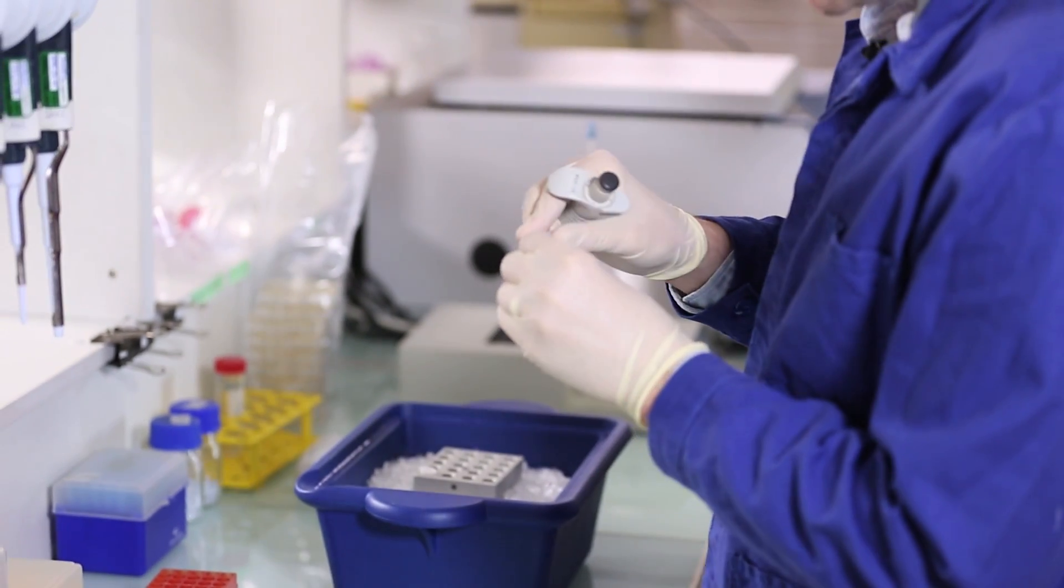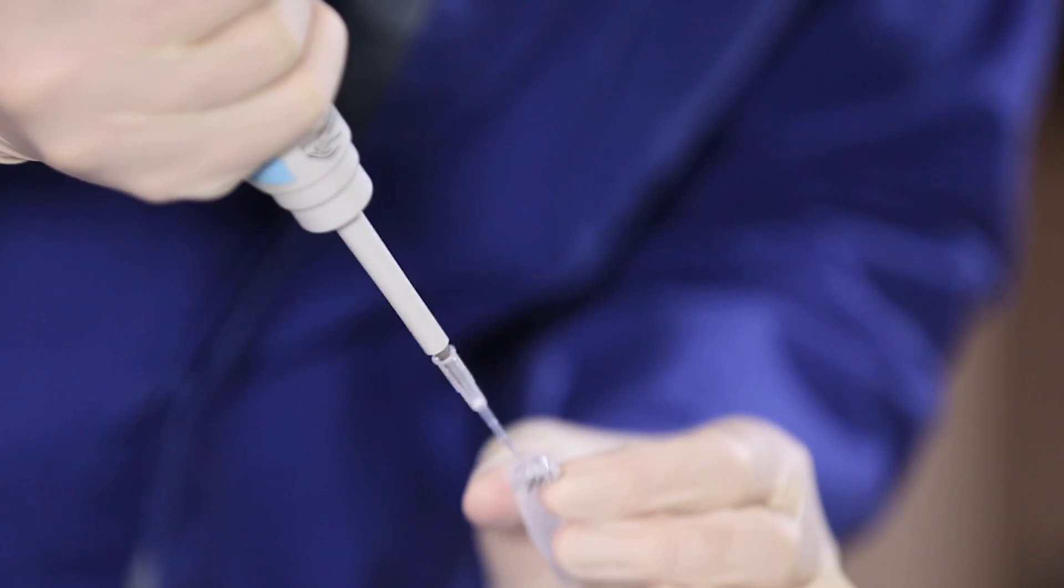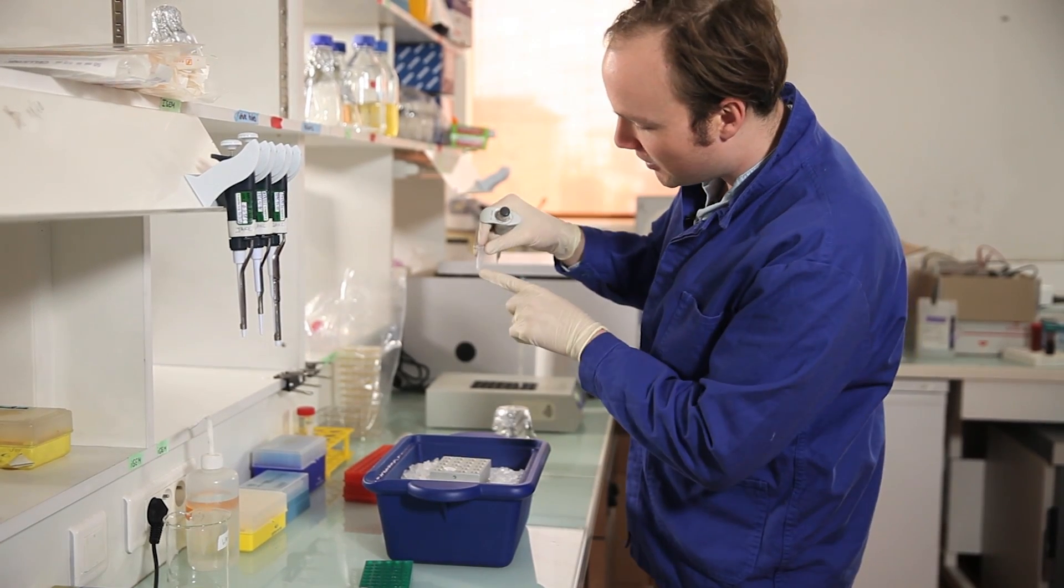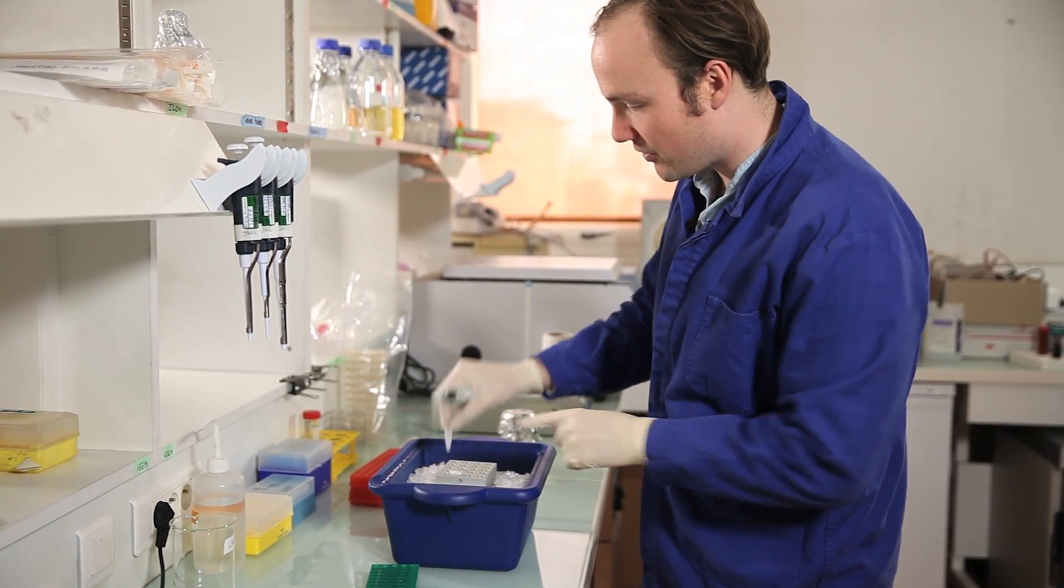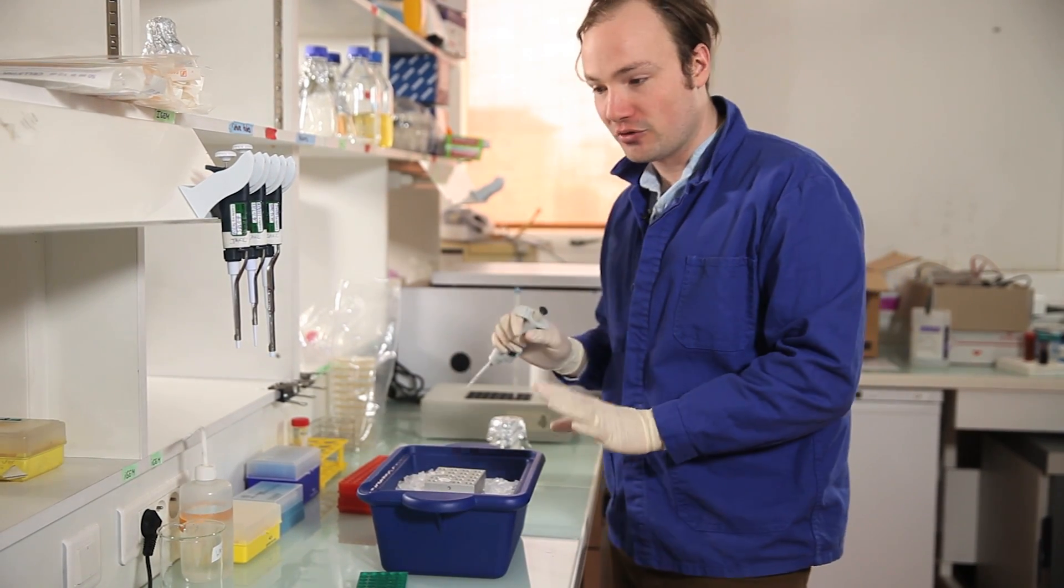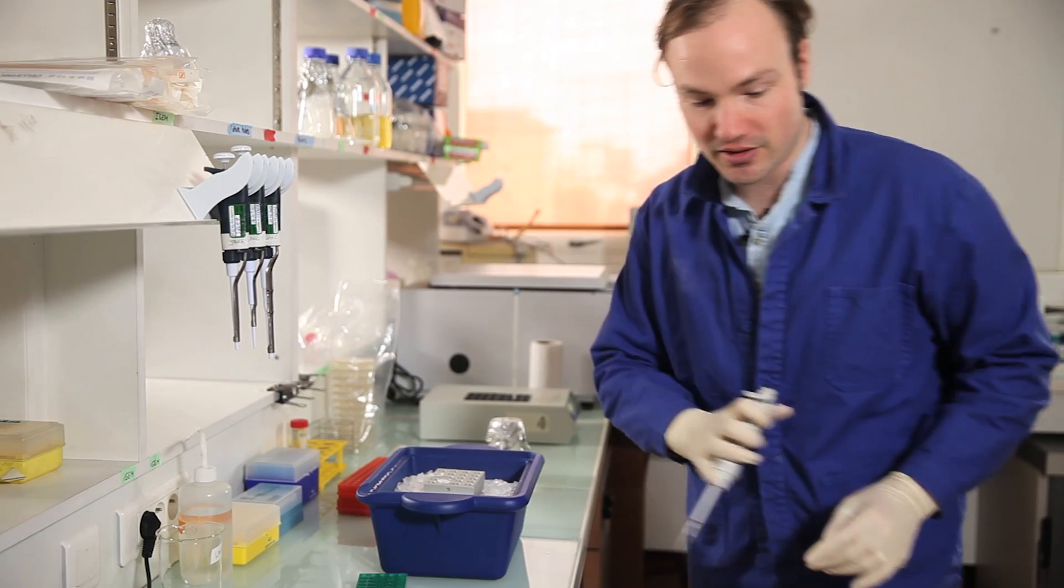Add that to our competent cells very gently. So you'll notice that I'm pipetting the plasmid directly into the cells, right? So when you're working with a volume that small, you really can't afford to lose anything. So you pipet directly on top of the cells.